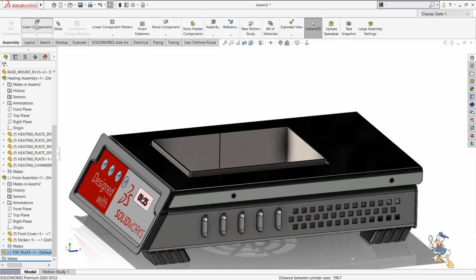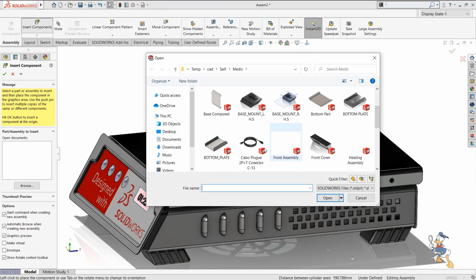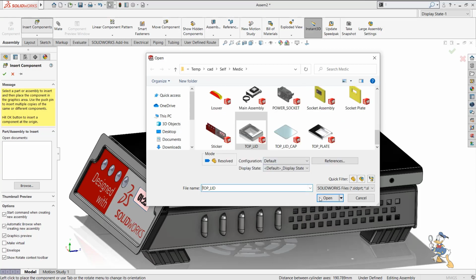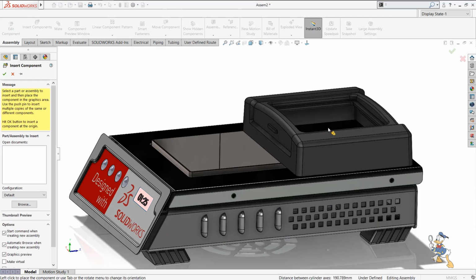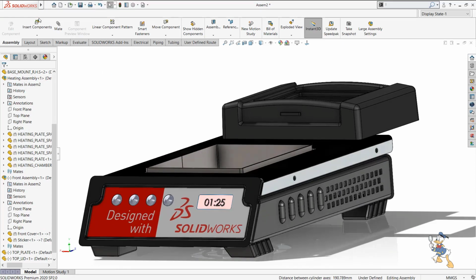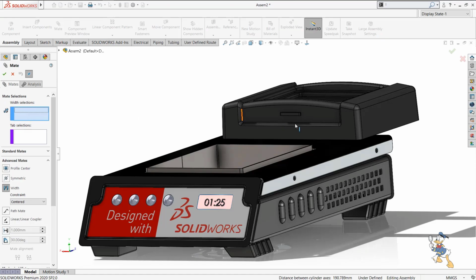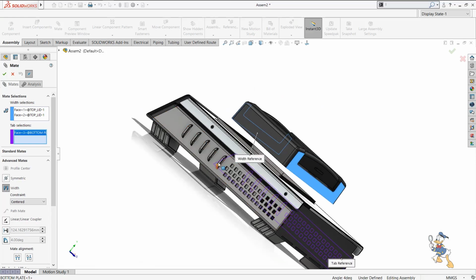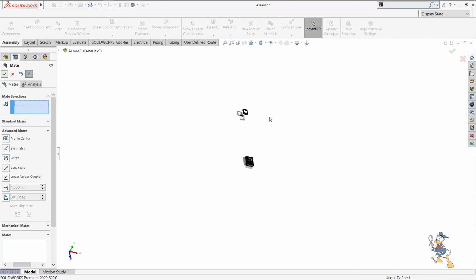I just need to place some more components, like a rubber component which we have designed previously. So I just need to select that component only and place it over here. So yeah, this one is the rubber component which we have designed. I just need to place it, and I just need to make some more mates to this, and by selecting this face to this face, this face to this face, it will automatically mate to each other.